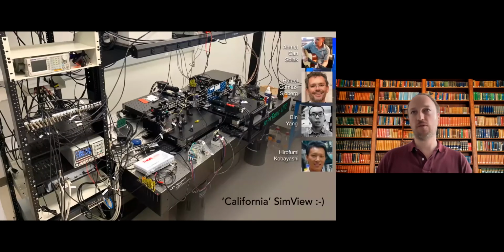So we do actually build these machines, right? And these machines produce a lot of image data. I'm not going to explain that to you guys. And this data are images. And so once you finish acquiring these images, you need to visualize them, right?